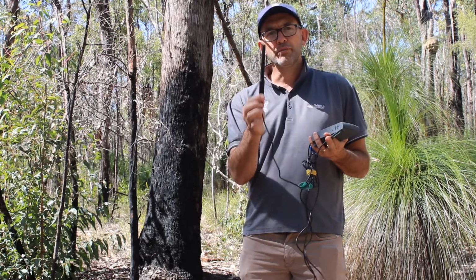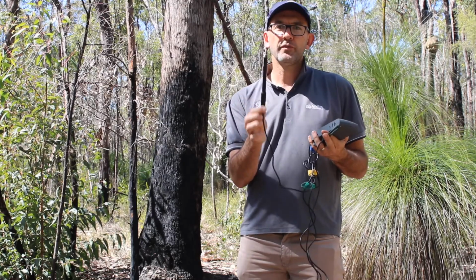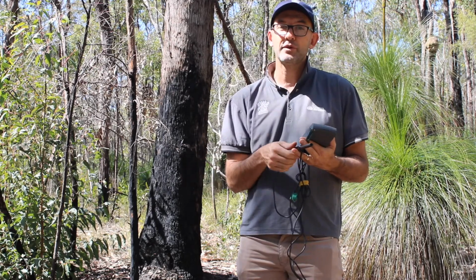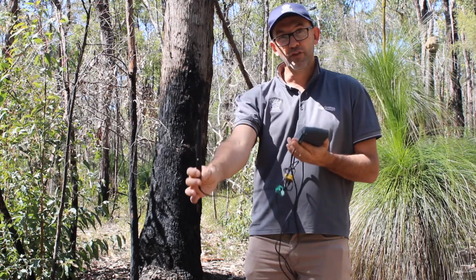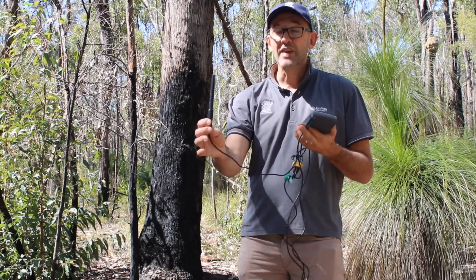But what we do is we make sure that when we measure that recording, the wind has stopped. The other thing is you need to hold it away from your breath. You hold it away from your breath because you have very, very moist air coming from your mouth, and that can impact your data reading as well. So a few things. Number one, hold this very, very far away from you so that you don't get your breath near it, and hold it low to the ground so you can actually measure that humidity as accurately as possible.